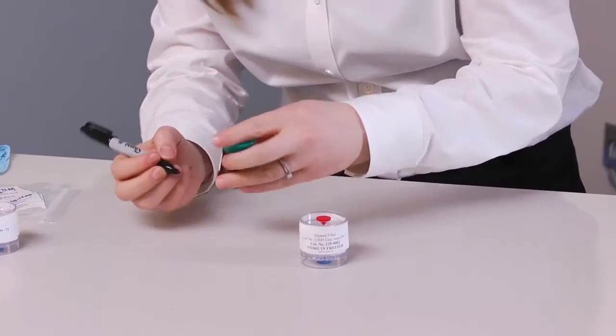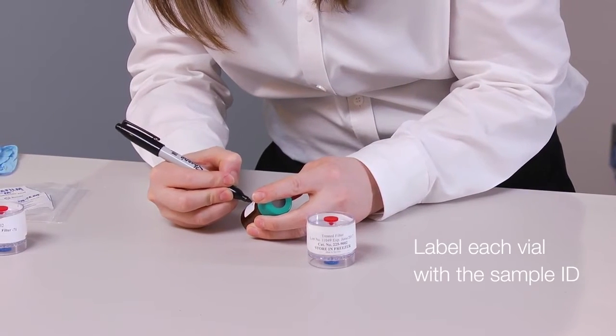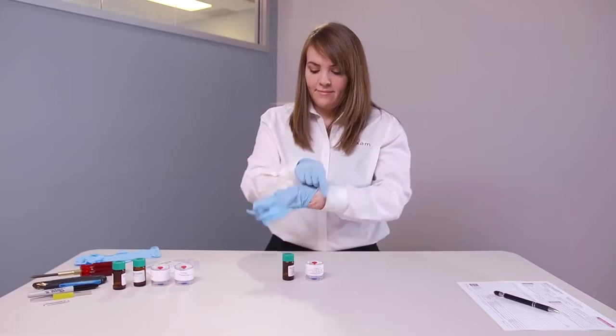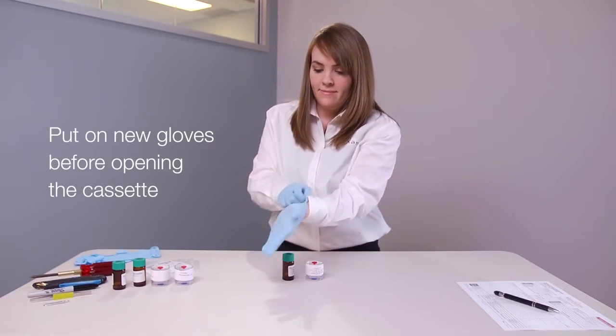Start by labeling each vial with the sample ID using a permanent marker. Put on new gloves before opening the cassette.